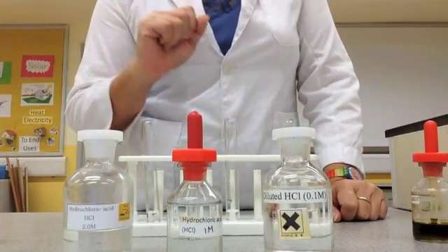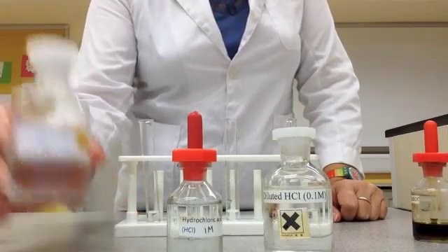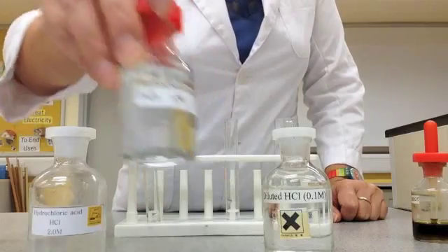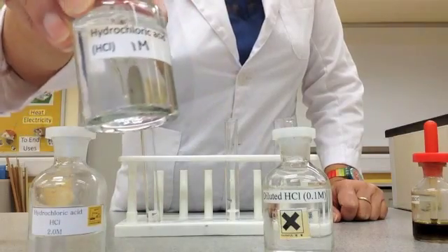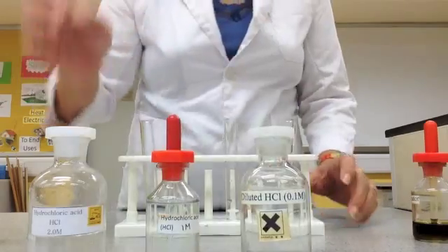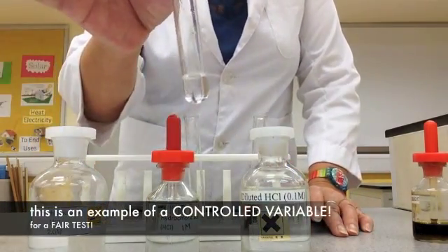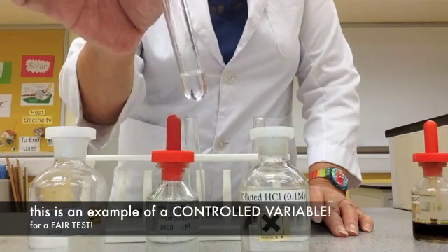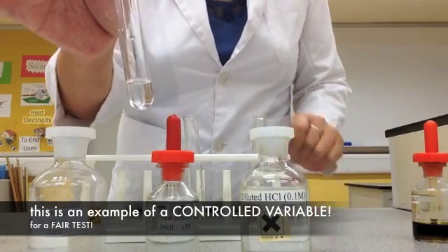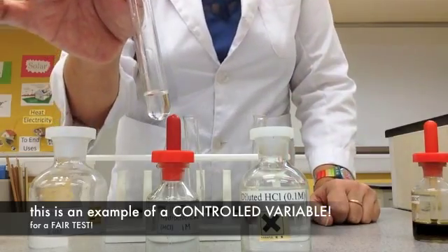We have three concentrations of hydrochloric acid: 2 mol, 1 mol, and 0.1 mol. I already put some in the test tubes, and I made sure it's the same amount. Why should it be the same amount? Every time you do an experiment, it needs to be the same amount so that it's a fair test.